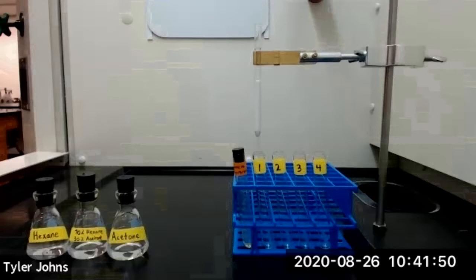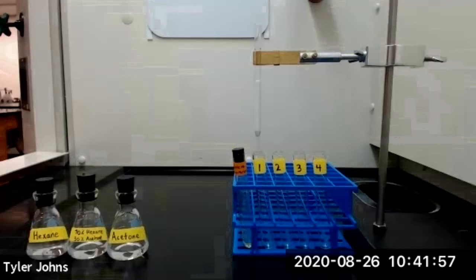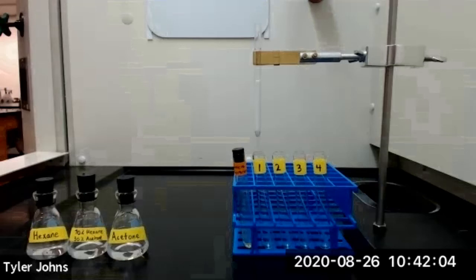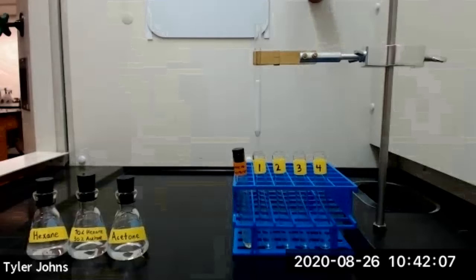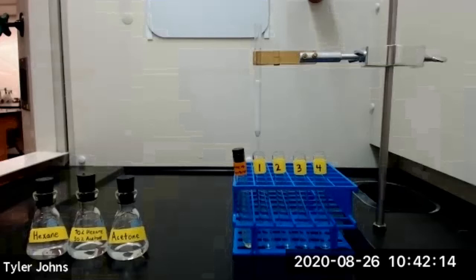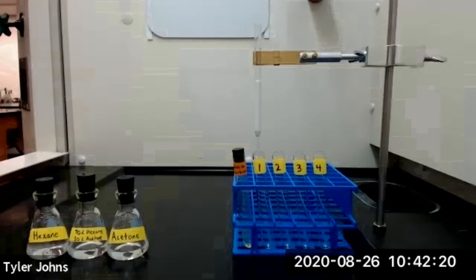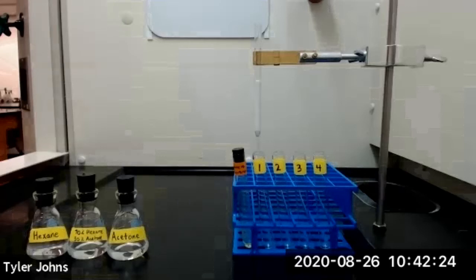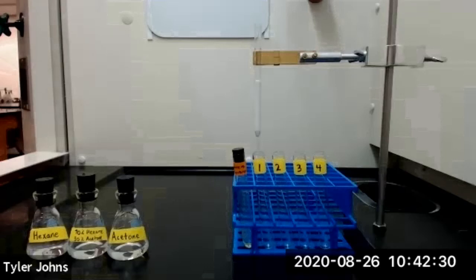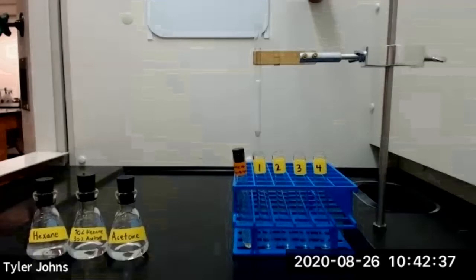Before running the column, I would like to briefly go over the procedure. We'll first add 3 milliliters of hexane to moisten the column, and once moistened, the column must not be allowed to run dry. We'll then add our fluorene-fluorenone mixture solution and collect the eluent in test tube number 2. We'll add 1 milliliter of hexane, and when the surface of the liquid reaches the top of the alumina, we'll add 5 more milliliters of hexane. As fluorene elutes off the column into test tube number 2, we'll need to use several drops of acetone to wash the solid fluorene off the tip of our column. After we've added all of the hexane, we'll switch to the more polar solvent of 70% hexane / 30% acetone. Just before the yellow band of fluorenone reaches the bottom of our column, we'll place test tube number 3 under the column to collect the fluorenone eluent.